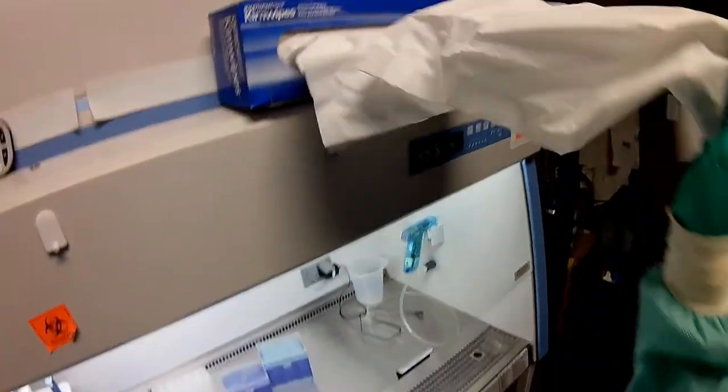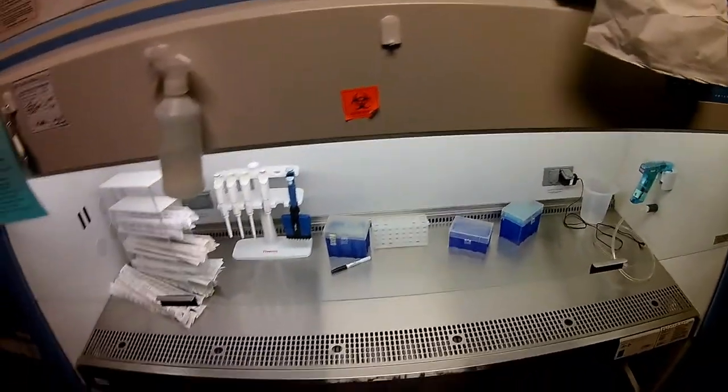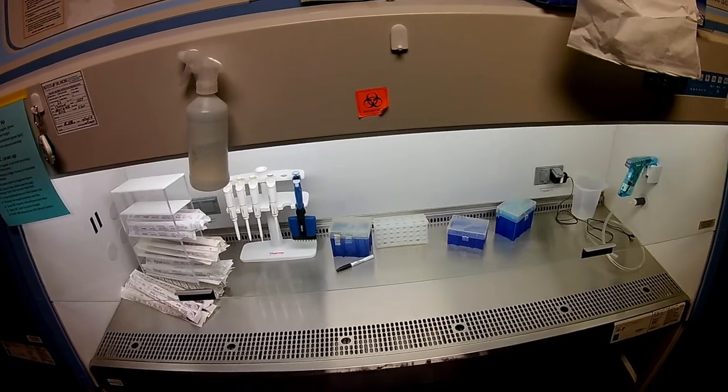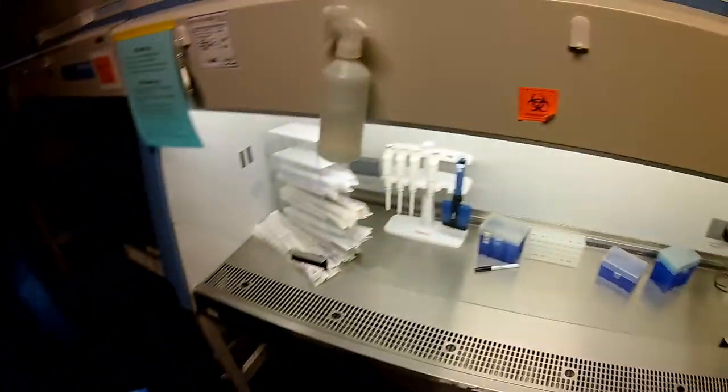I'm going to go ahead and take this to rub it in. It's not really to dry the ethanol. That's not our goal. It's just to make sure all the surfaces kind of get wetted with ethanol, because we want the ethanol to evaporate and therefore kill any microorganisms. So I'm just going to throw this away in the biohazard box.